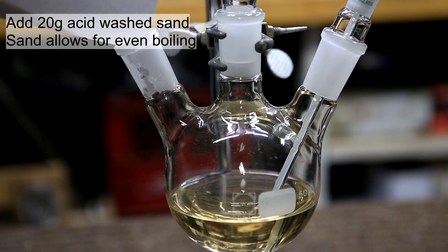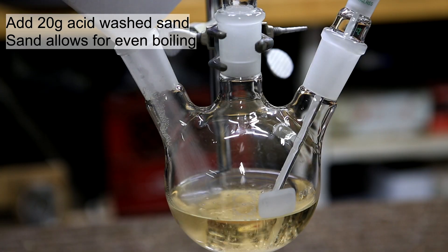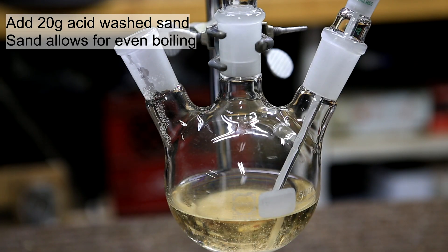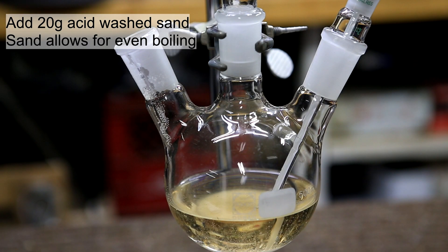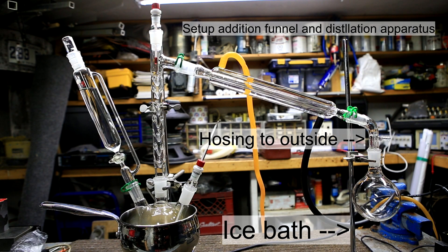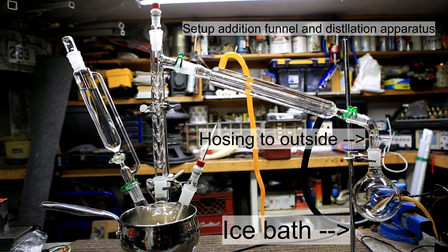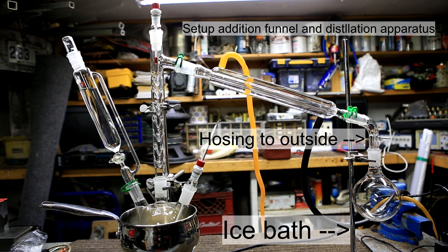After the addition of the sulfuric acid, the flask was removed from the water bath and 20 grams of acid-washed sand was added. The solution is yellow because the sulfuric acid I used was slightly contaminated, but this shouldn't affect the reaction. My apparatus was then set up as shown. An addition funnel was attached and an oil bath was set up. I used a fractional column, but you can do simple distillation, though you will have more water and sulfuric acid in your final product.